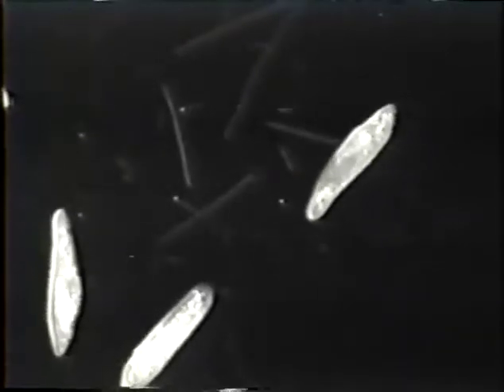Now this is a group of paramecium under the influence of their MOR. As you can see, if you've ever seen paramecium before under a microscope, these fellows are quite motile, but here they're quite all stunned, and that's typical of paramecium at 1150 cycles when the device is operating.